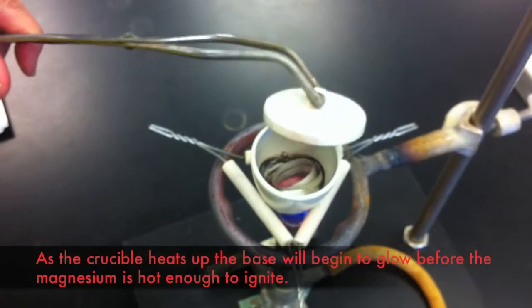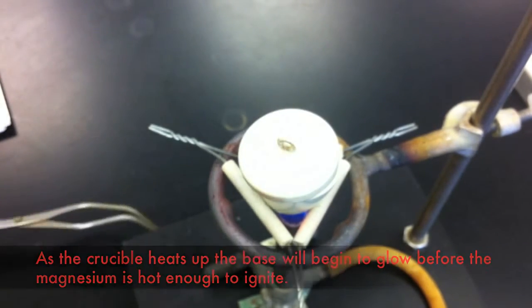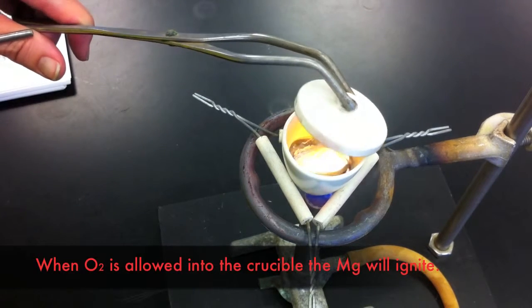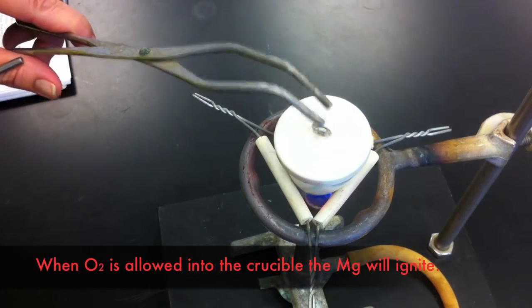The high temperature will cause the magnesium to ignite, though first the crucible will begin to glow with the heat. Raising the lid of the crucible will allow oxygen from the air to enter the crucible. This will ignite the magnesium, causing the formation of magnesium oxide.